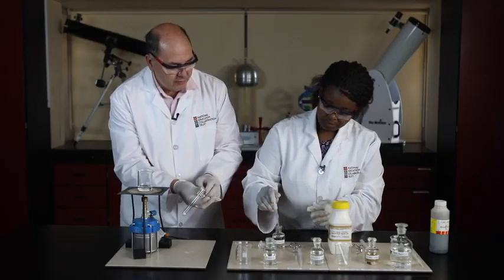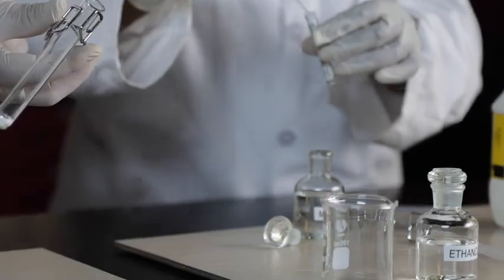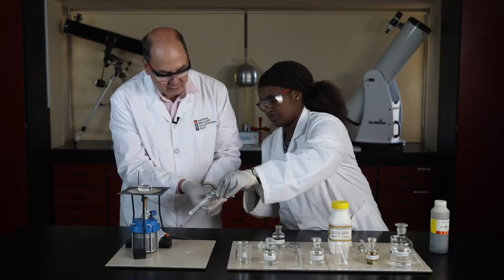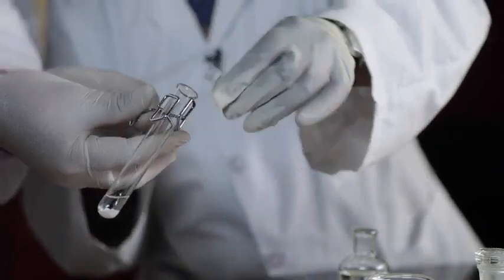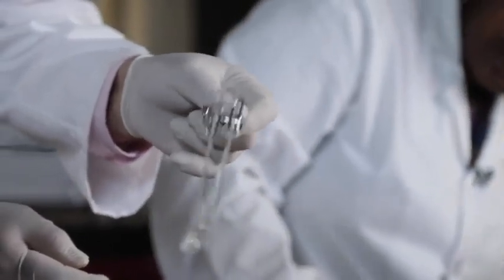So take 3 mL of the methanol, add it to the boiling tube. There we go. Shake it around. Now make sure that it flows down so we can get all of that stuff. That's it. Beautiful. Lovely. You'll see that the acid hasn't totally dissolved, but I'm swirling it, more or less dissolved.